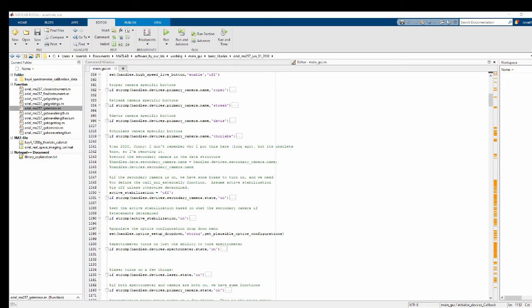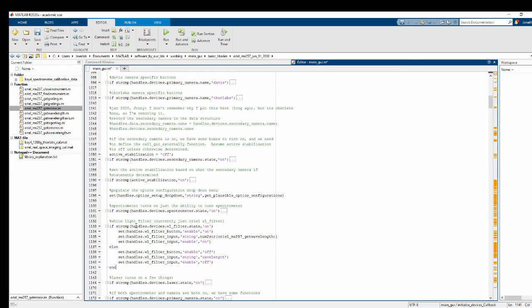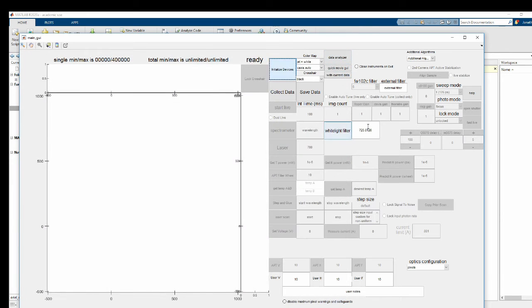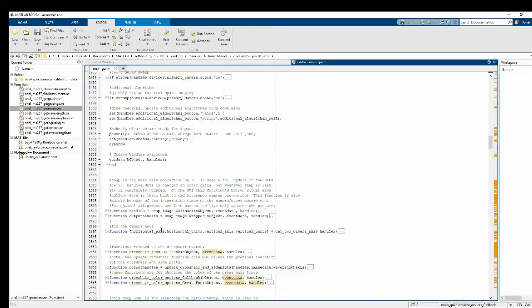And I'll just copy and paste this code that I already wrote. There. So, if the white light filter state is on, turn on the filter button, set the current input field to whatever the current wavelength setting is, and set the input field to be enabled. Let's go ahead and check. Okay, it turned it on. Now, of course, if I type in some random number here, nothing's actually going to happen because we haven't programmed that in yet. Let me just check my notes. Okay, our next step is to code in the callback functions for those buttons so that something will actually happen.